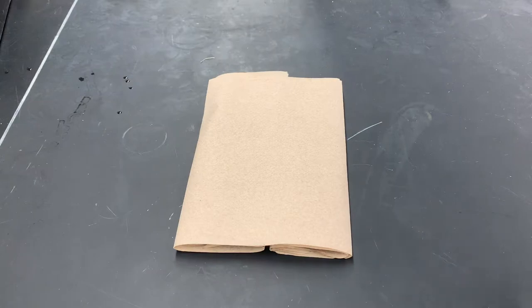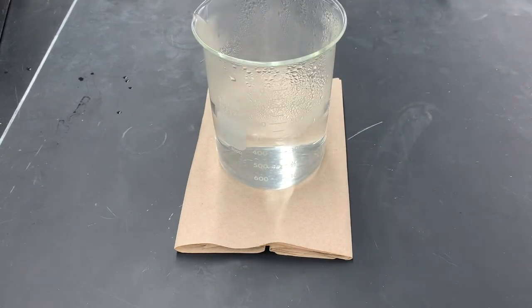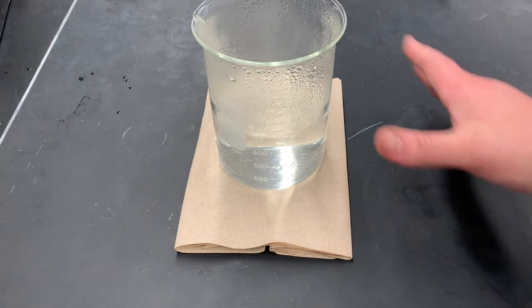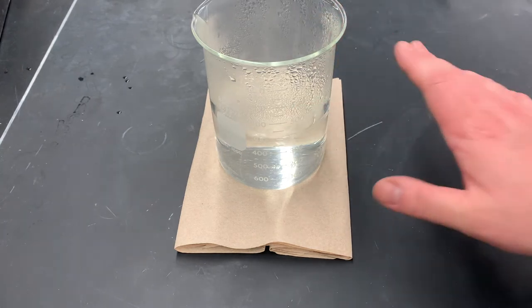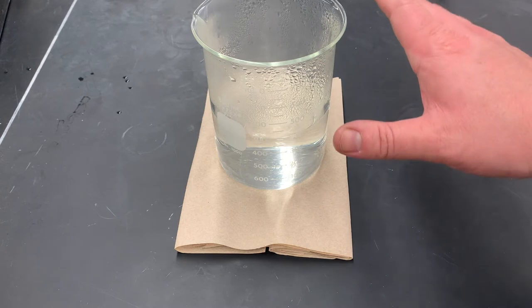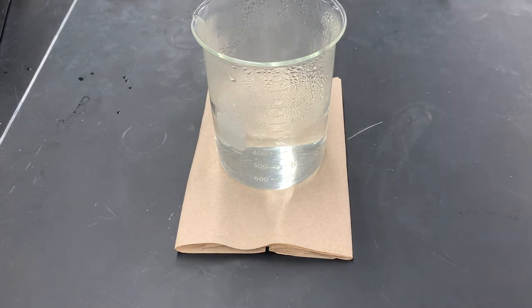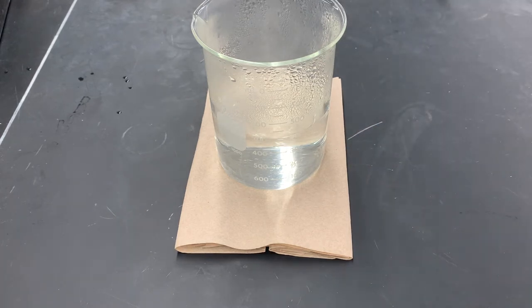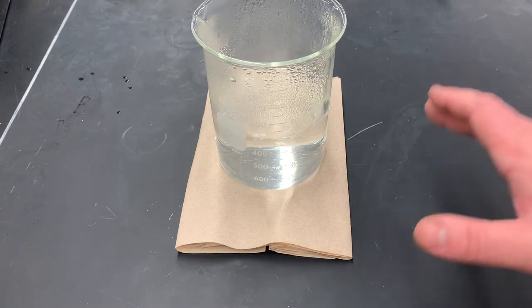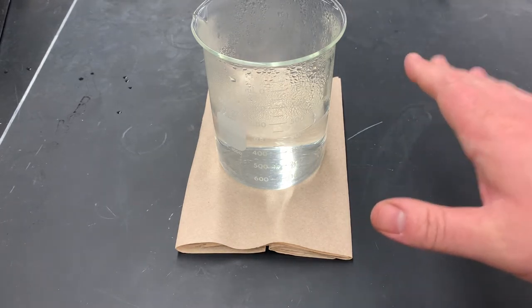I've put down a few layers of paper towel and taken down our hot water. I don't want to put it directly on the bench top — it might shock the glass and break it — so paper towel is a good insulator. We'll leave it here to cool so we can actually work with it. We don't want to stir it because we don't want to reintegrate any more carbon dioxide, so we'll just leave it as is.